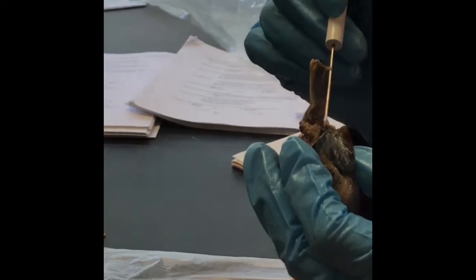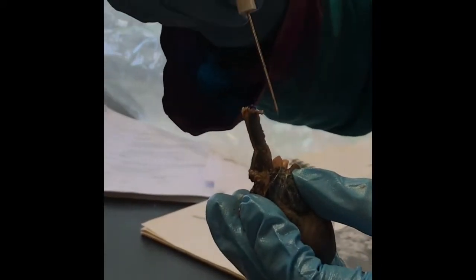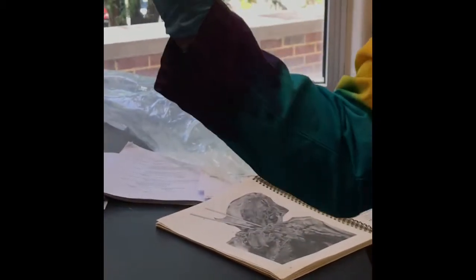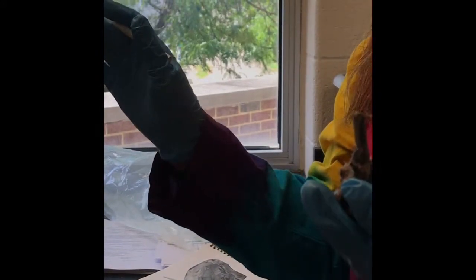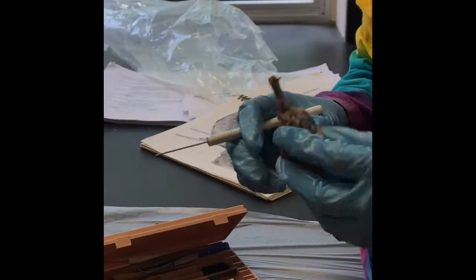I'm going to have to find another heart. The first branch off of the heart is the brachiocephalic. So I will have a heart with a pin sticking off that first branch. Say, what branch of vessel is this? And you'll say the brachiocephalic, because then it's going to branch off into all of the vessels, the carotid and the subclavian, to go above the heart. I'll find another heart for you to show you that. Okay?